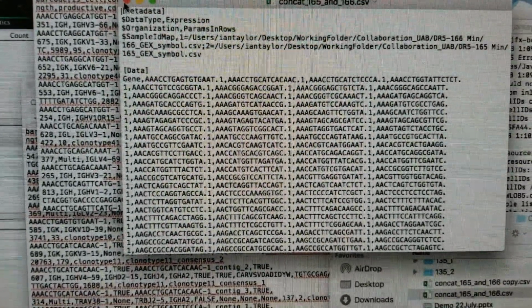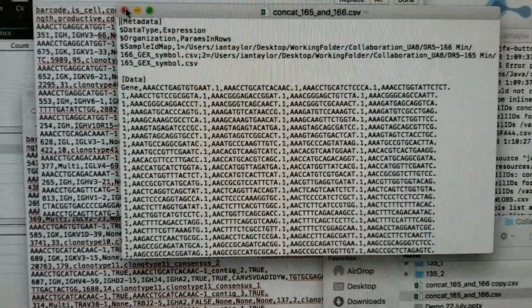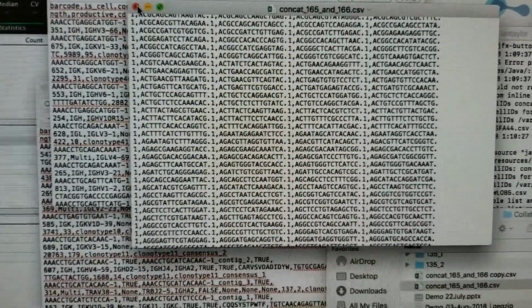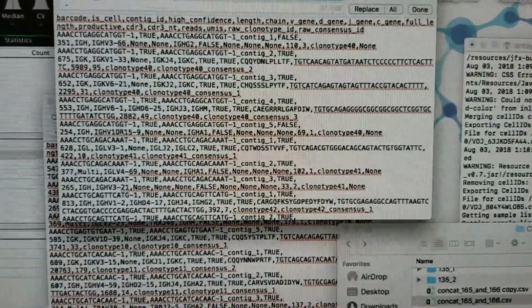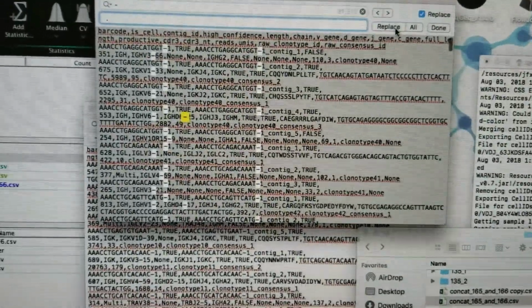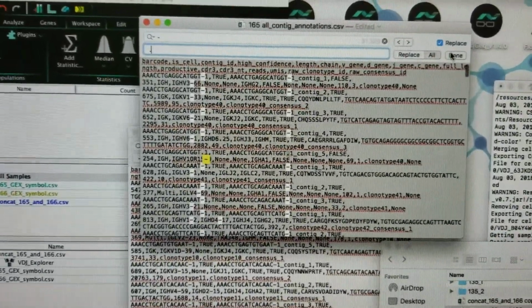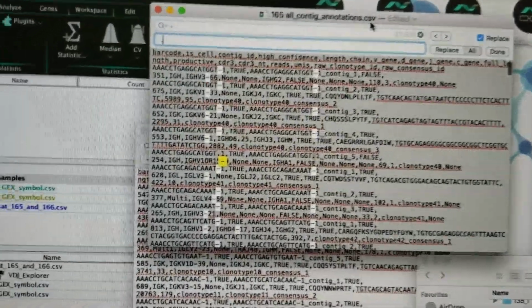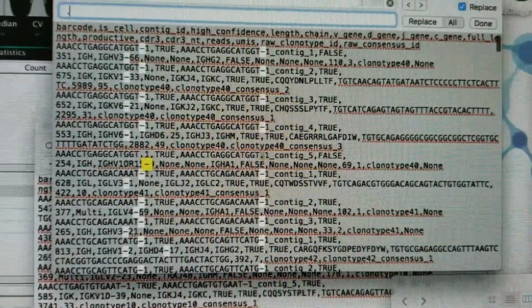So I'm going to go ahead and change that back to dots. And that's really, really simple. We're just going to do a search replace for that character. So let me close this down. And now we're looking for dashes, and we're going to change that into dots. I'll try that out with a couple of these. Looks like it's changing them fine, so I'll replace all. And then go ahead and save this all contig annotation file once it's finished with the search replace process. Any questions on that so far?